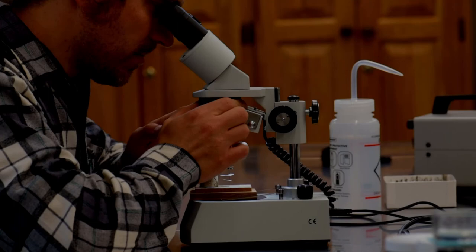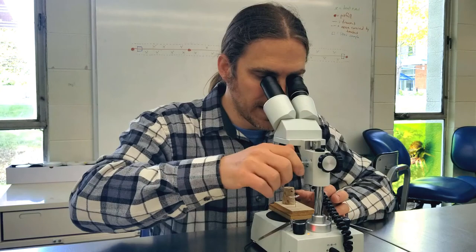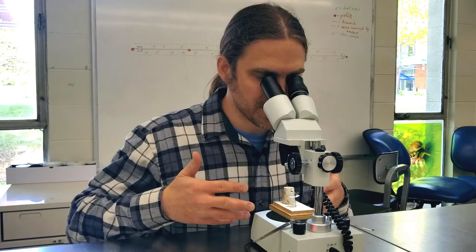If you can't see your specimen very well — in this case I can see the specimen but it's just kind of dark and I can't see many features on it — look back and check that the light is turned on. There's enough ambient light from outside the microscope to find the specimen, but once you turn that light on, it brightens up and you can actually see features on the insect.